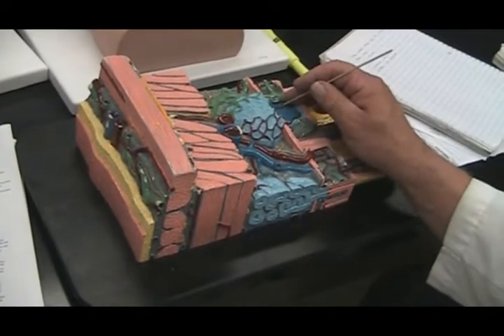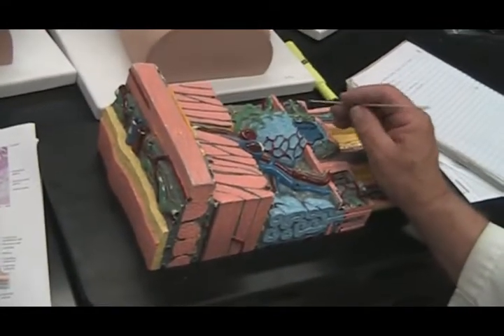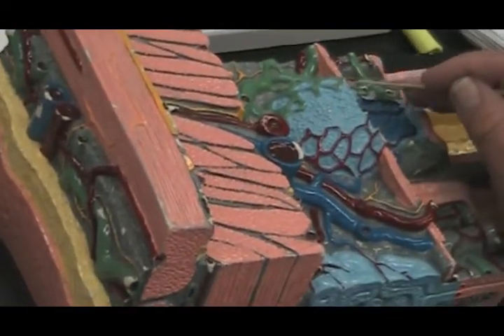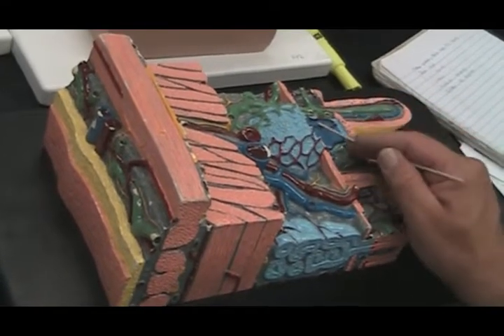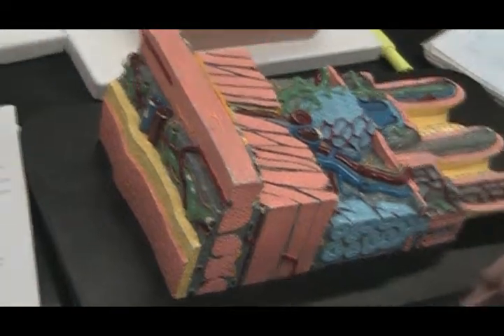Does it say lymph on there? Yeah, you're fine. Lymphoid nodules. It's basically a lymph node without the connective tissue covering. So it's lymphoid tissue or lymph nodule. Any of those terms is fine, once you know what to look for.